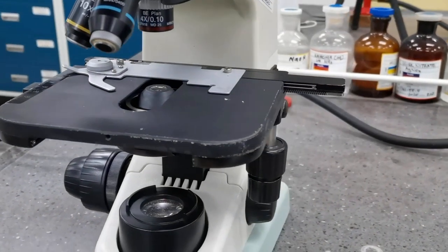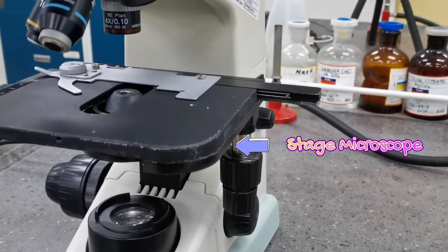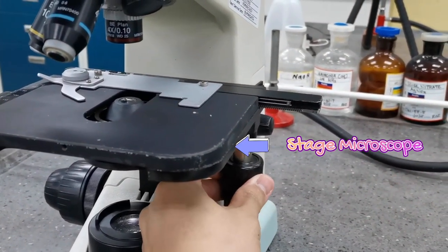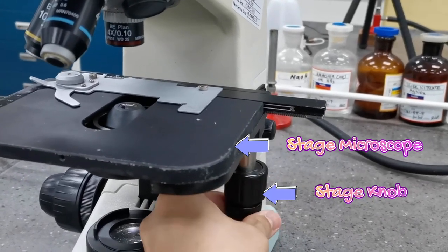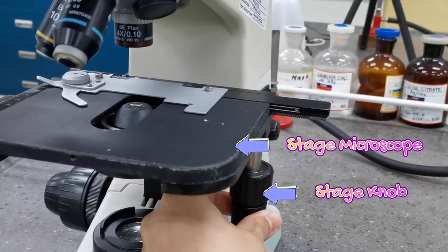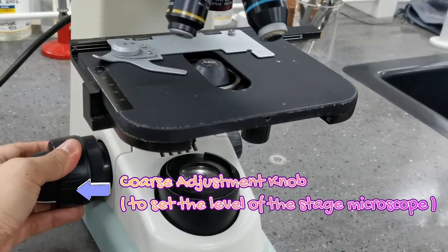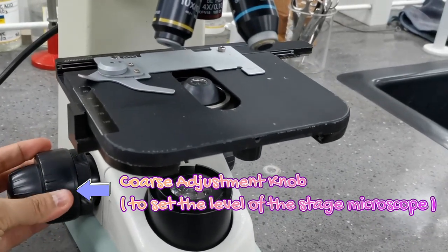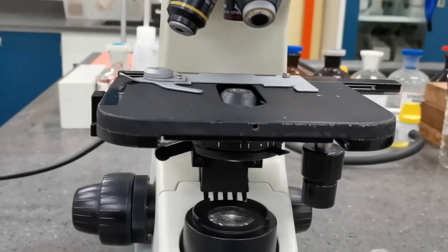Now we will look at the stage. This is where you'll place your slide, and you'll use these knobs to control left-right and up-down movement. This is the coarse adjustment knob, used to control the level of the stage.